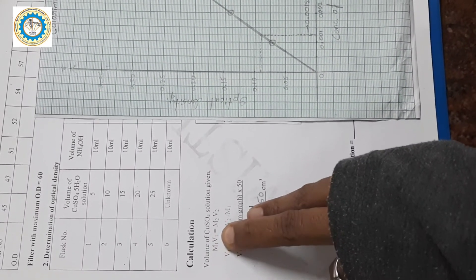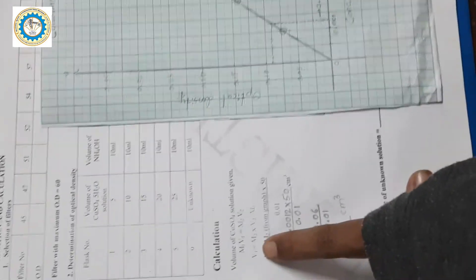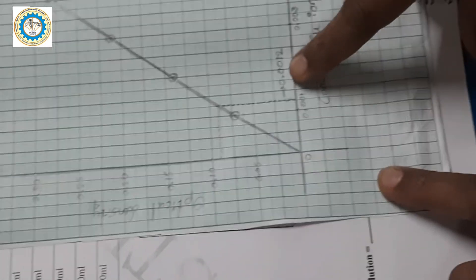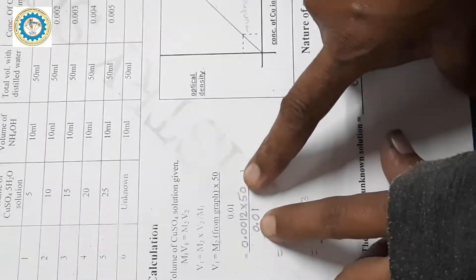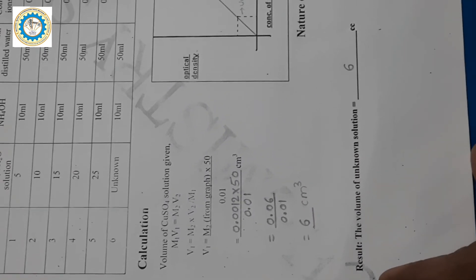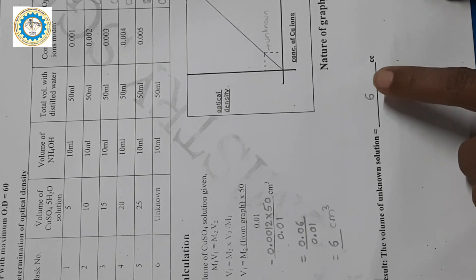We will go for the calculation using M1V1 = M2V2, in the same way as N1V1 = N2V2. V1 = (M2 × V2) / M1. M2 is obtained from the graph as 0.0012. The volume of the volumetric flask used is 50 ml. The molarity of the copper sulfate is 0.01. Doing this calculation, we get the answer as 6 ml. The amount of copper sulfate taken in the preparation of the unknown solution is 6 ml. The result is: volume of unknown solution is 6 cm³.